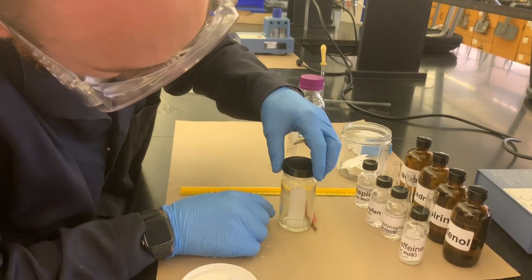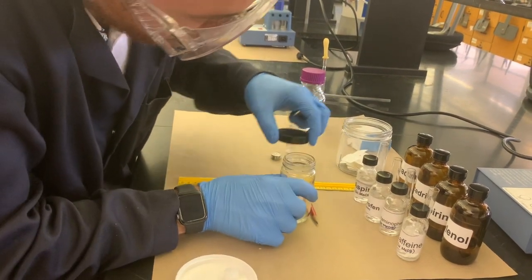All right, so it looks like we have this done. It just needs to come out.